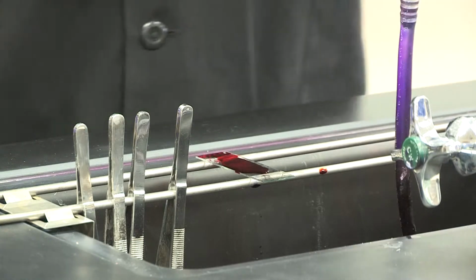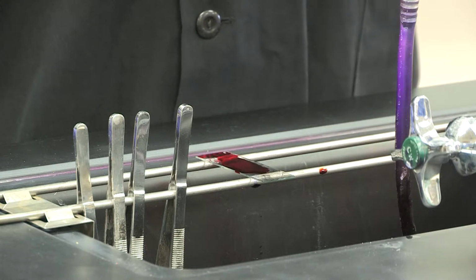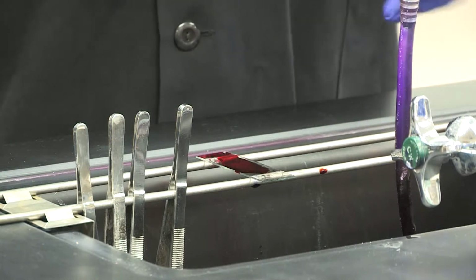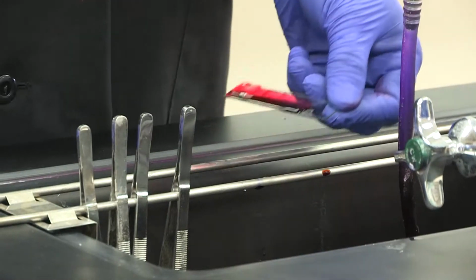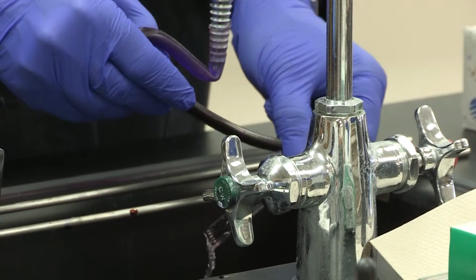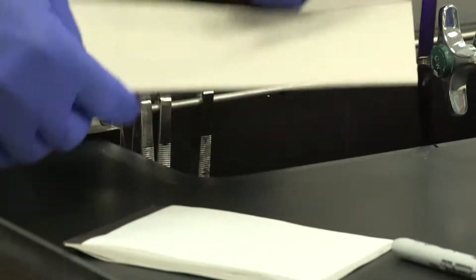So in reviewing the stain, we did the heat fixation, we did the crystal violet for 1 minute, we did the iodine for 1 minute, we did the alcohol for 5 seconds, and now we're doing the safranin for 1 minute. And you're rinsing in between the steps. Okay? Now, once you have waited about a minute, you're going to, again, rinse off the safranin. Okay? Now, after that, this slide is good to dry, and it has to be absolutely dry.